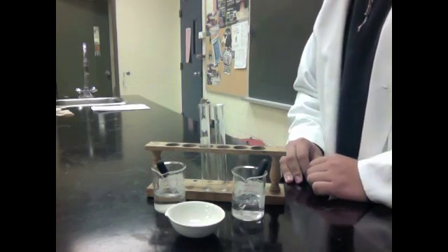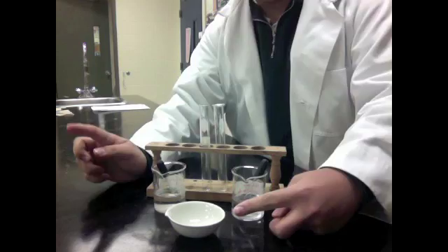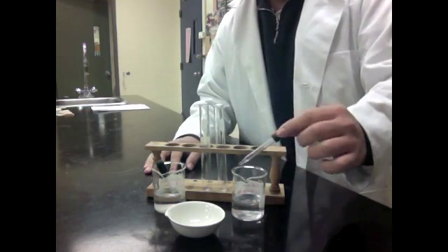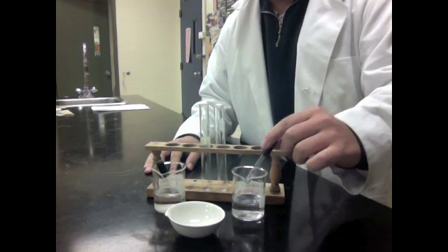Secondly, we will be pouring each solution into a separate test tube and then pouring them into the crucible. First, I will take one eyedropper full of sodium hydroxide and pour it into one tube.